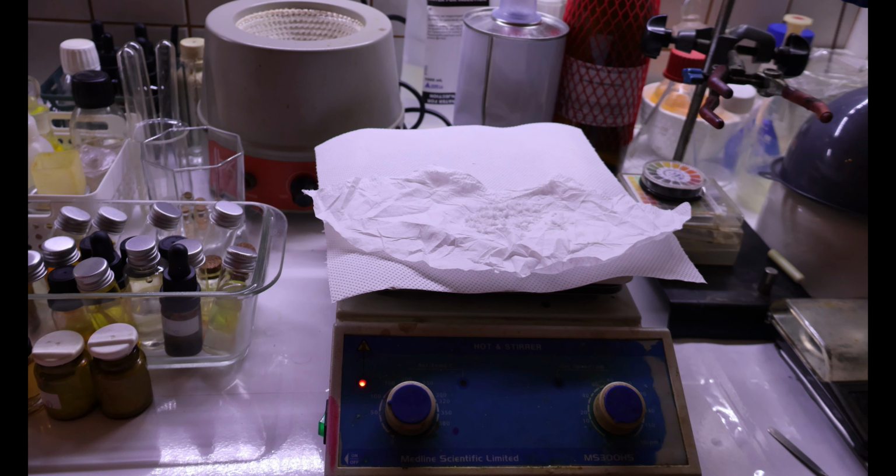So we know we have something that's not salicylic acid. Now, could it be something else? Very well, it could. Is there anything else it could really be? I don't think so. It's most likely acetylsalicylic acid.